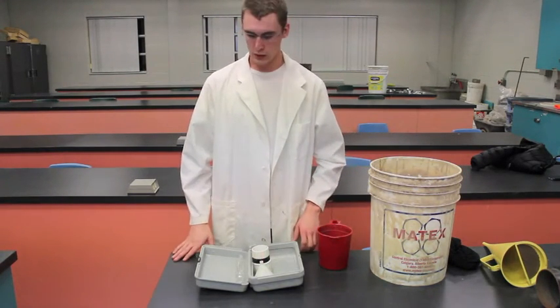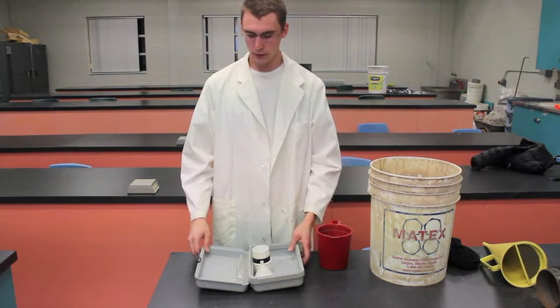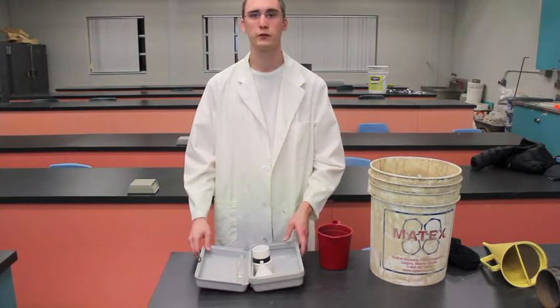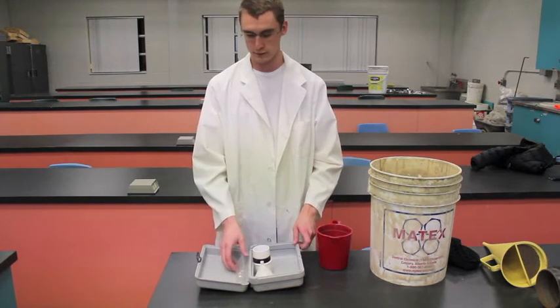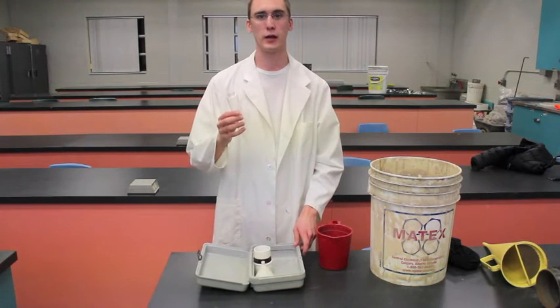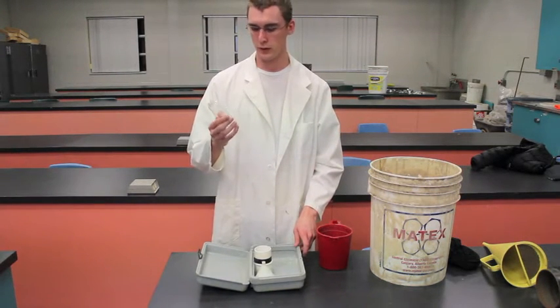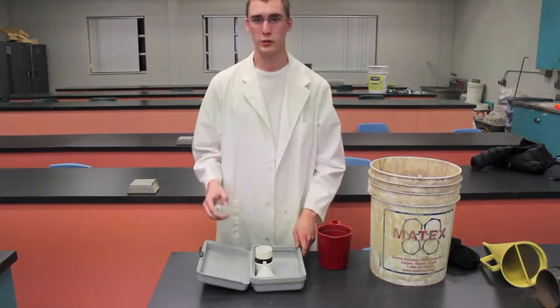Our desirable limits for the mud is we don't want any more than 2% sand by volume. And this tube will measure that and give us a representative sample of how much sand we have in our mud drilling fluid.